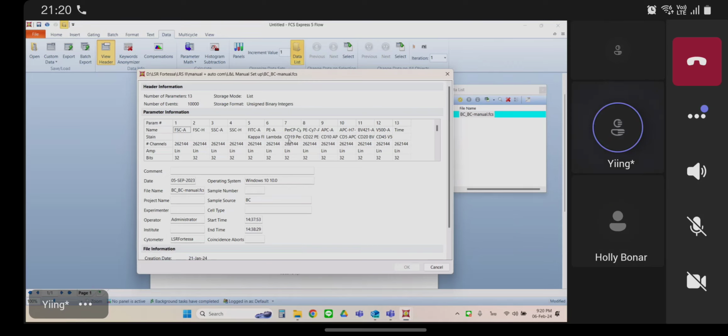But I cannot do that about LSR. Anyway, I don't know why the parameter is missing. My guess is it has something to do with the way you exported it from the instrument at the time you exported it, because FCS Express is just reading the parameters that are in the file. So if they're not there, like in this case, this particular data file doesn't have the width parameters.